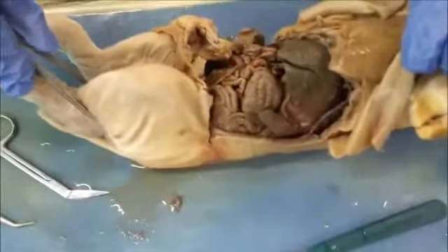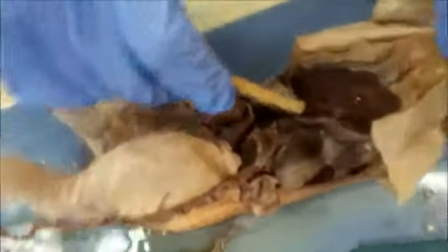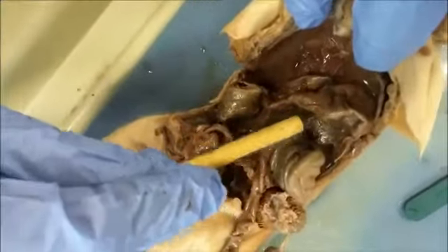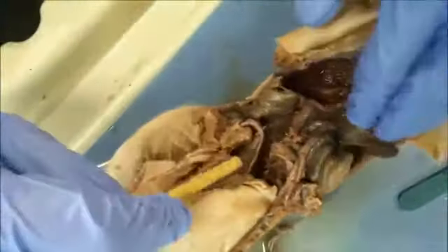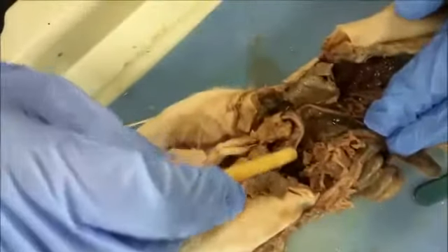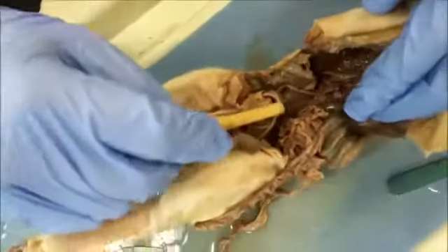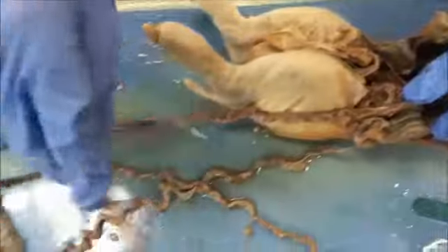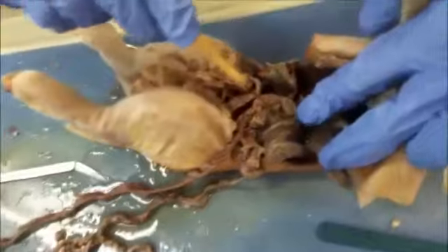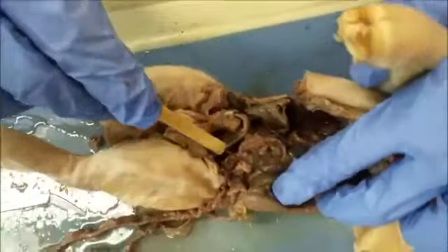We'll now be removing the liver to better see the gallbladder. We've just moved the liver. Now you can clearly see the stomach and the spleen. Up here you can see the muscle wall of the diaphragm. And down here beneath the duodenum, you can see the pancreas very faintly through the mesentery. It's right there. This duodenum flows down into the intestines, all scattered throughout here, which will eventually lead back up into here, where it connects with the large intestines, and water absorption will begin in the large intestines.